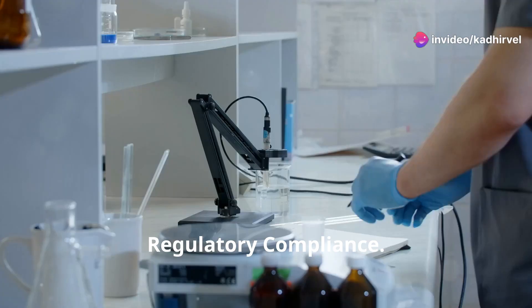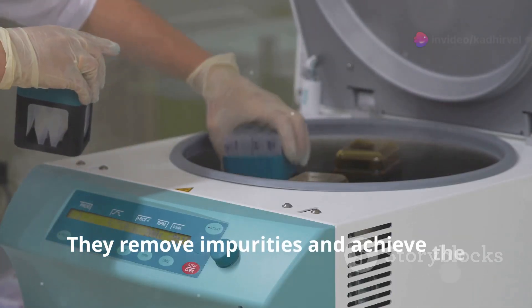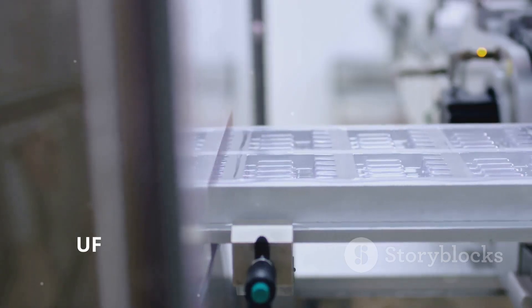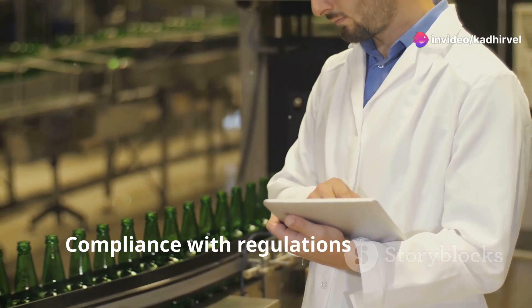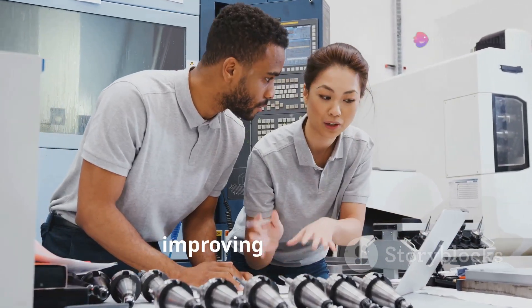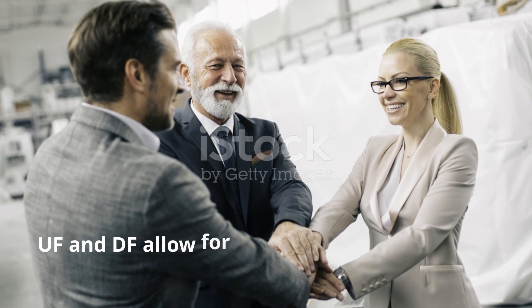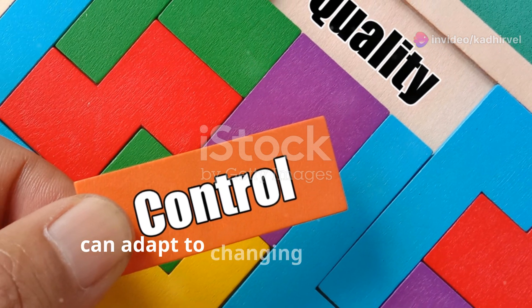Ensuring quality and regulatory compliance is paramount in MABs production. UF and DF play a critical role in ensuring this quality — they remove impurities and achieve the desired concentration, resulting in high-quality MABs that are safe for patients. Regulatory bodies have strict guidelines for MABs production, and UF and DF help meet these guidelines by ensuring the final product is pure and properly formulated. Compliance with regulations is essential for market approval. Cost-effectiveness is also important: UF and DF reduce production costs by improving efficiency and achieving high yields with minimal waste, making MABs production more affordable and accessible. UF and DF allow for flexible production scales, which is important for both small and large production batches.